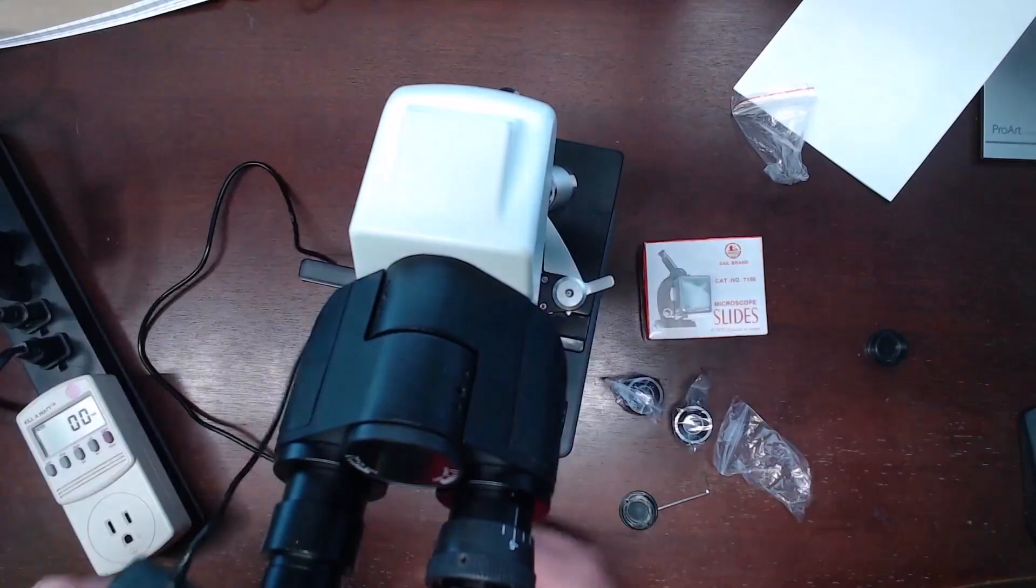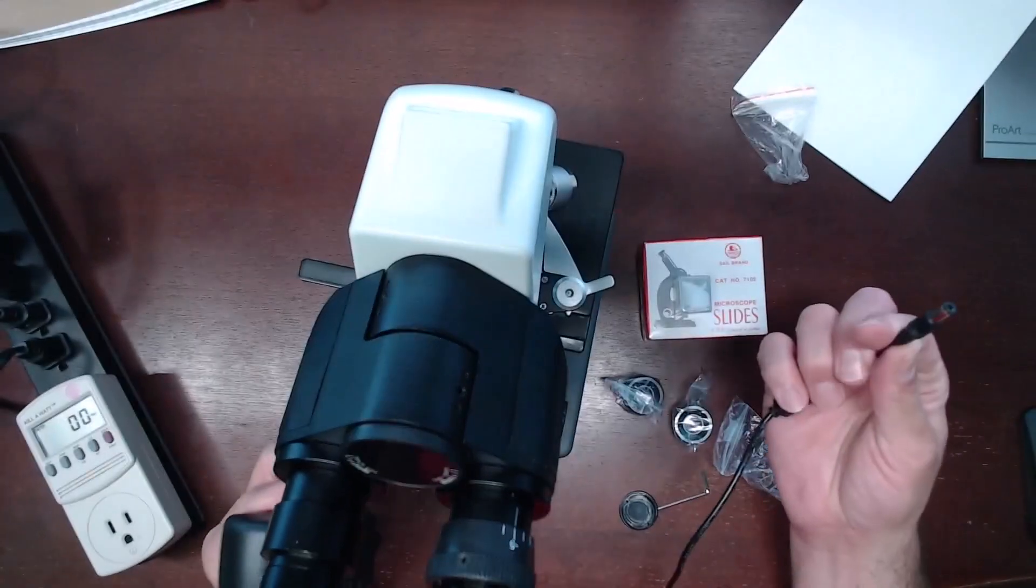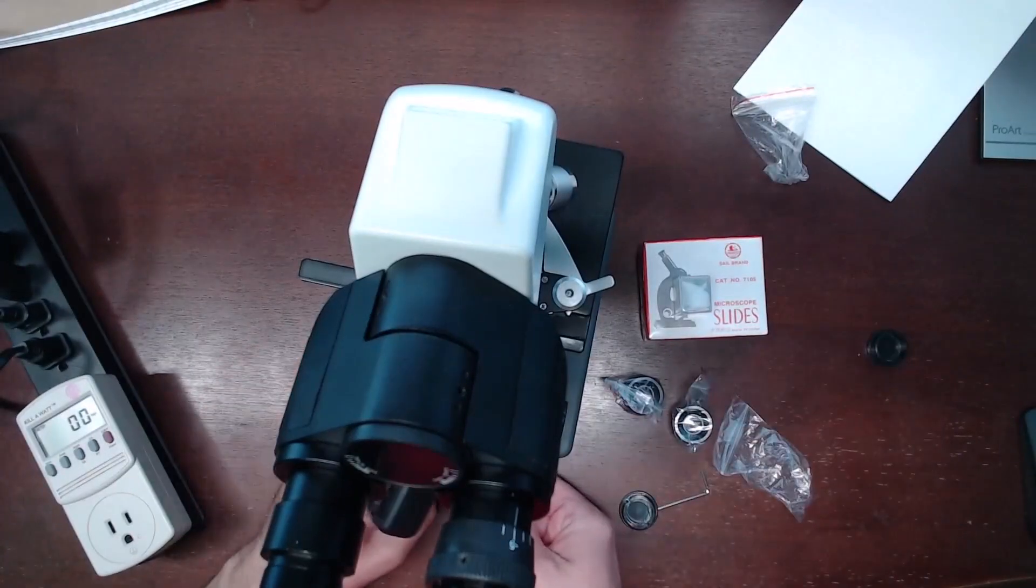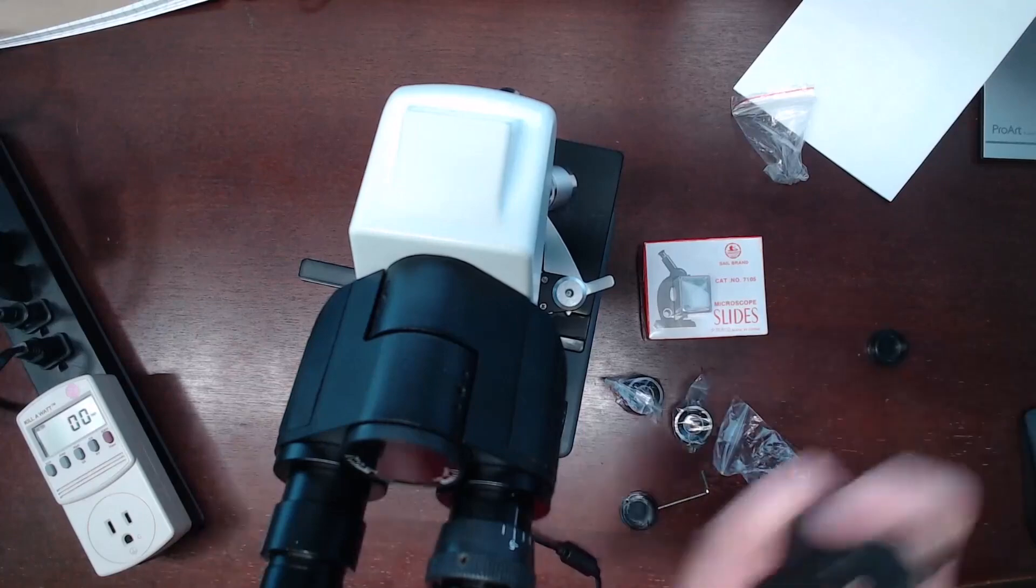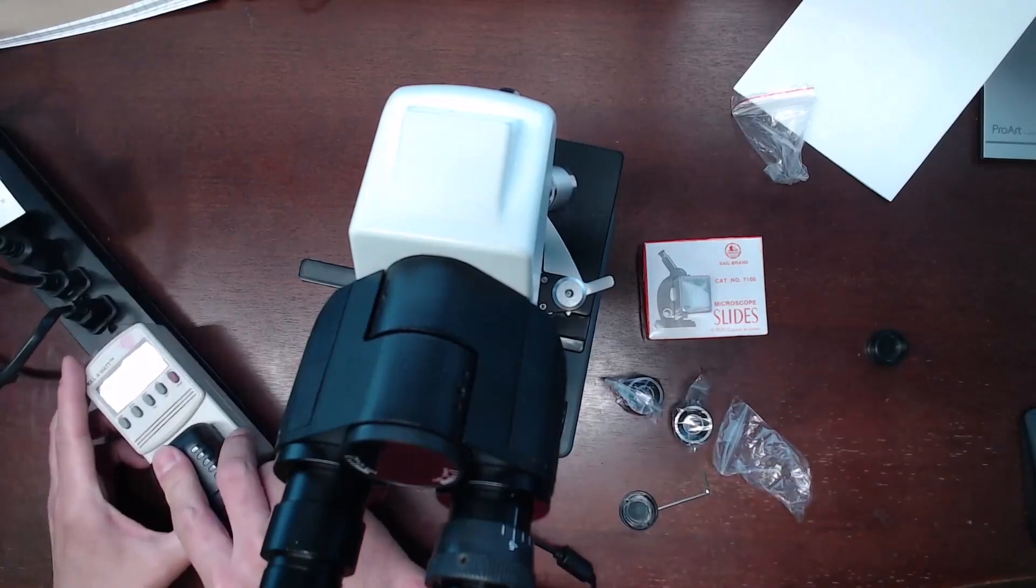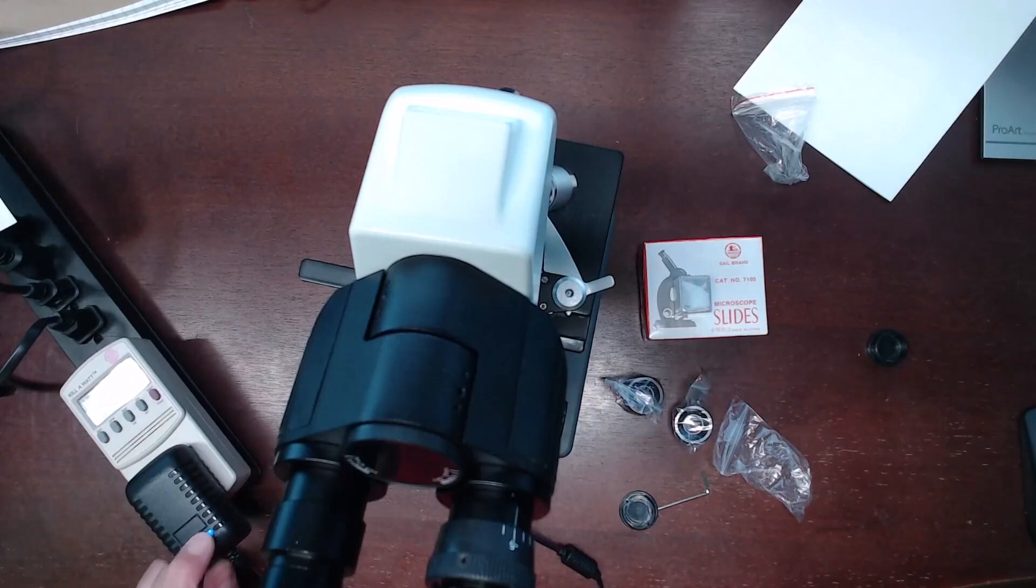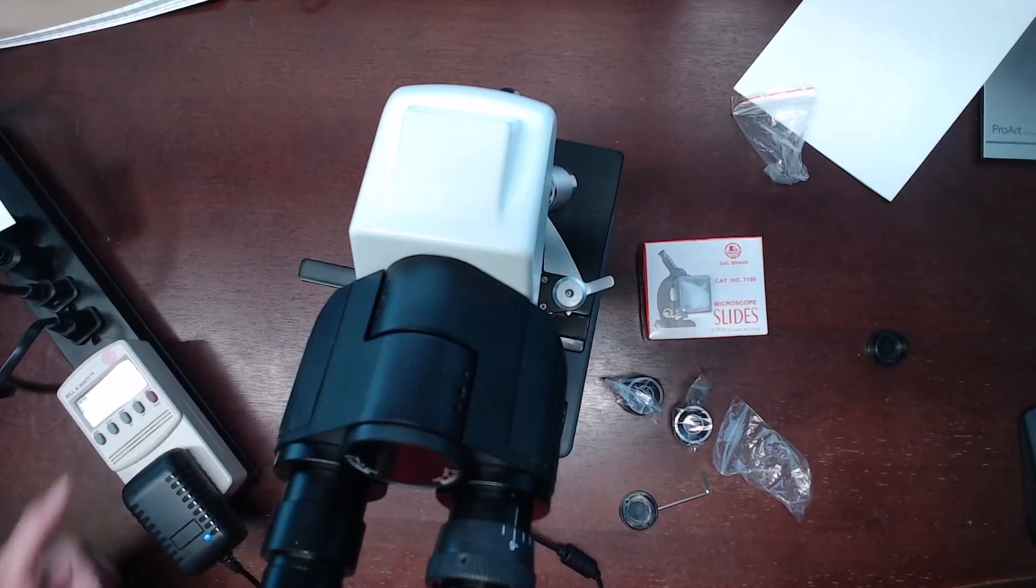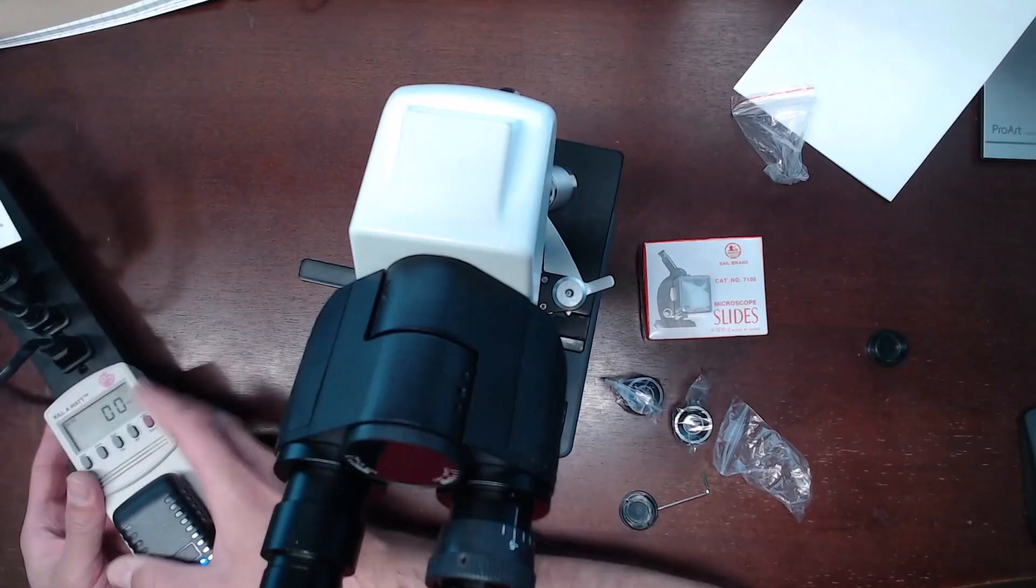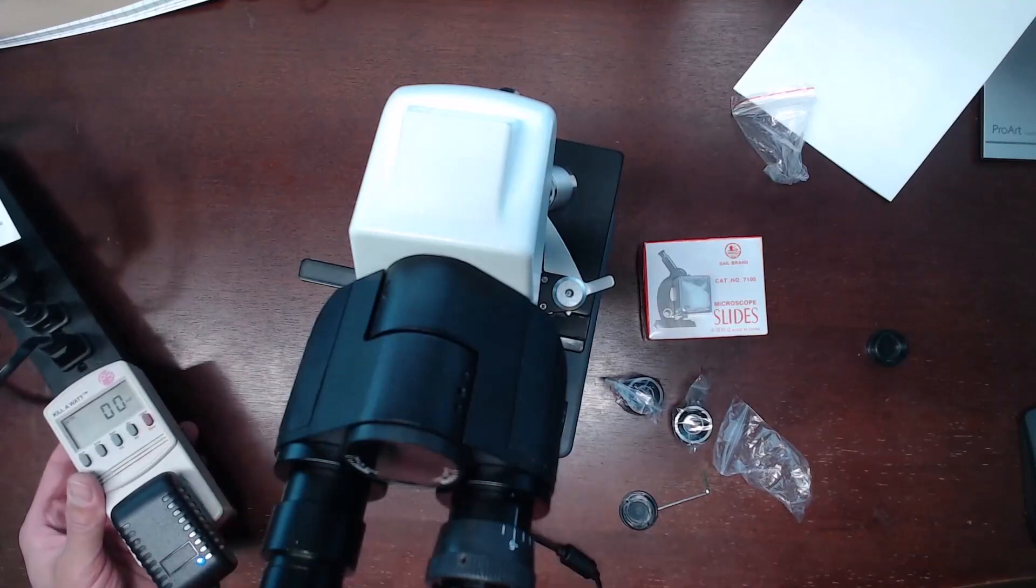Next we are going to plug in the power source. We are going to put the barrel plug into the back of the microscope and then plug this into a power supply. And as you can see the status light does turn on. And right now with it powered off we are showing zero for the power draw.